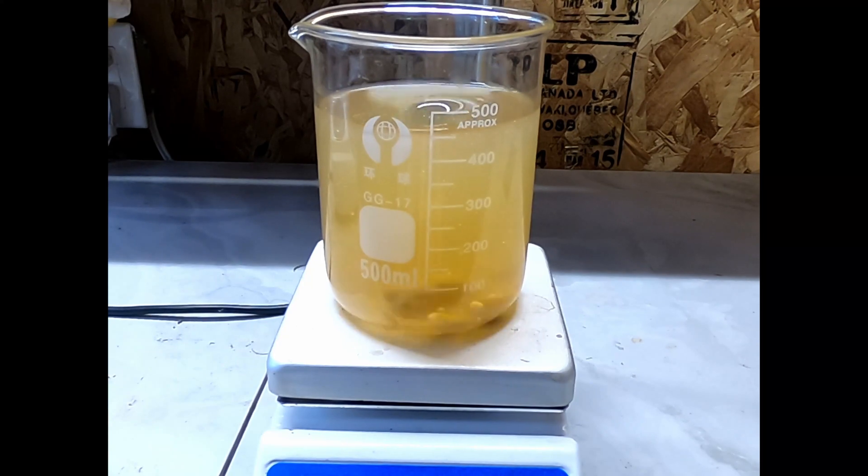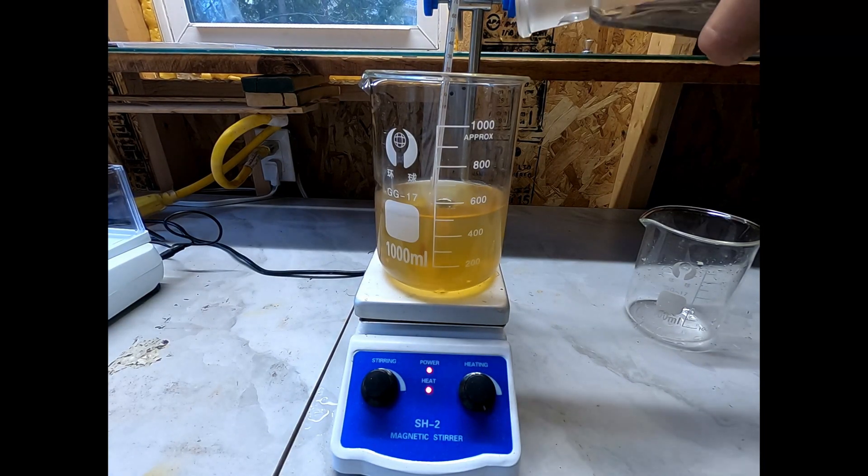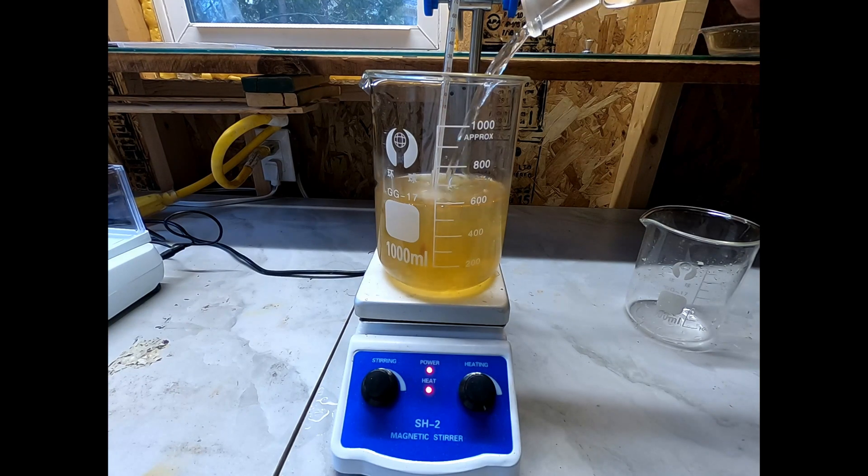On top of that, the fact that I made a pretty big mistake when calculating the amount of water I needed didn't help, so I estimate my yield below 50% for this procedure.